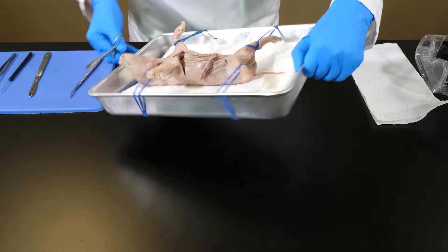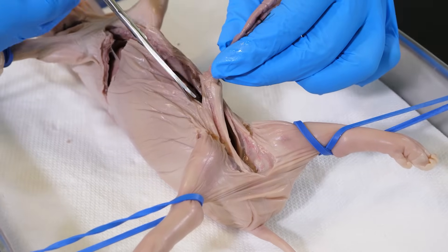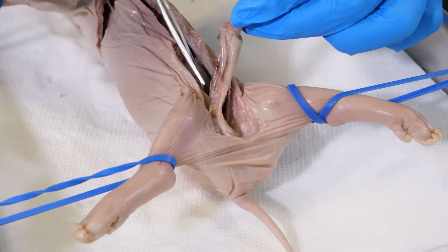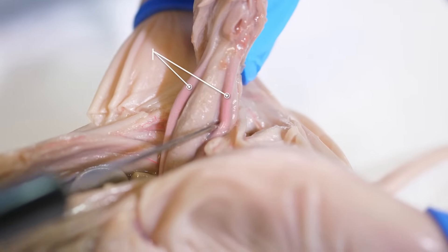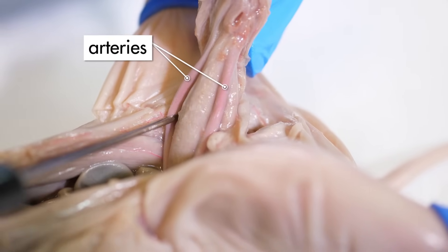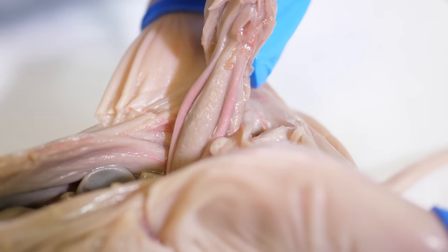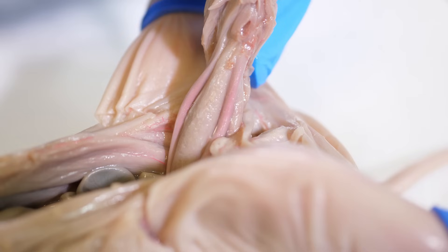After cutting through the ribs, we turn the tray around and begin cutting around the umbilical cord. Now we can pull up on the umbilical cord and see where it continues into the pig's body. The umbilical cord contains two arteries and a vein, which connect to the circulatory system. The two arteries lie on either side of the umbilical cord and are easily seen. The vein is deeper inside the umbilical cord, so it is not visible.